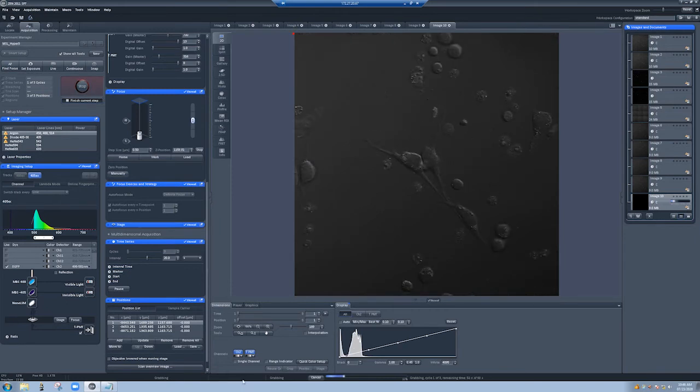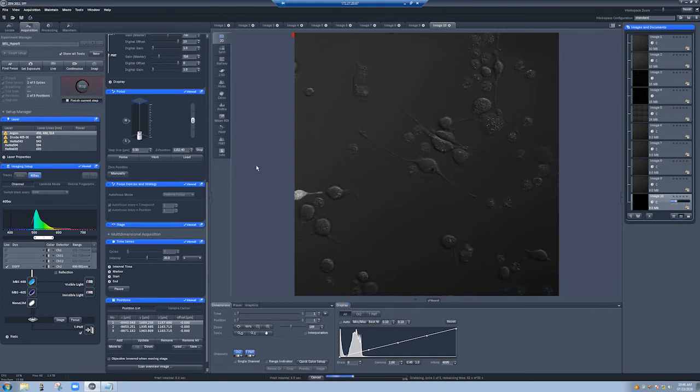You can see down here when the definite focus is being engaged, you can also see those bars up there. Now we're in the wait interval. There's a 20-second wait between each imaging run. So we've done the definite focus. We're doing it again. We've completed the second cycle with 3 positions, and we're in the wait interval, and we're about to start the third cycle.